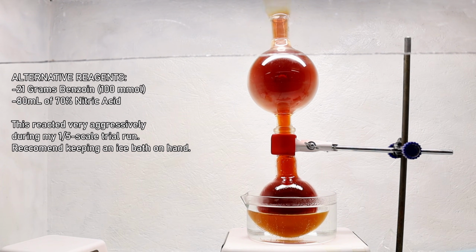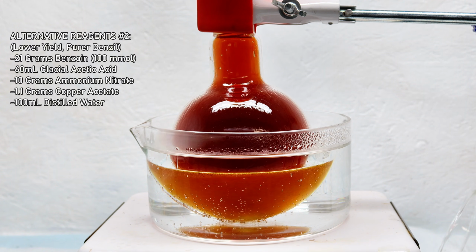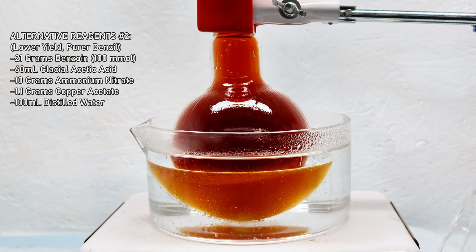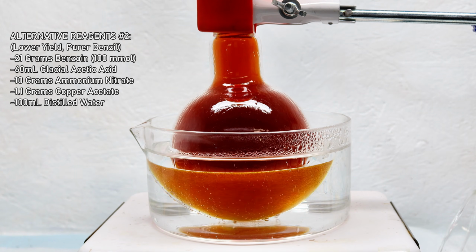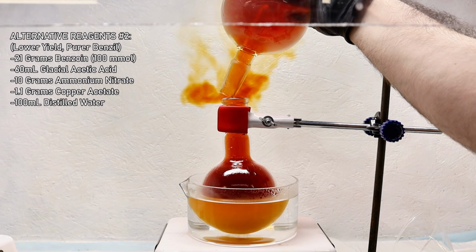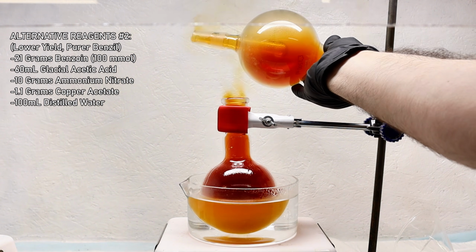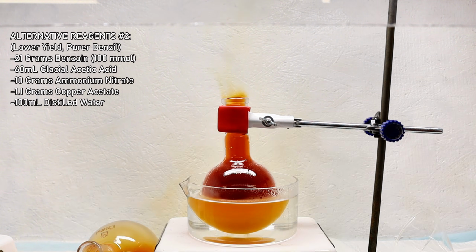Also, if you remember a few minutes ago, I did say that nitric acid is the ideal oxidizer for this reaction. But that's really only true if percent yield and speed are your biggest priorities. However, the problem with this specific procedure is that it'll always leave a tiny amount of unoxidized benzoin. This impurity is fairly difficult to remove, but I figured it probably wouldn't cause me any real problems. There is an alternative procedure that will reliably yield 100% pure Benzil, but it takes more time and produces somewhat lower yields. This alternative procedure uses ammonium nitrate as an oxidizer along with a copper acetate catalyst.